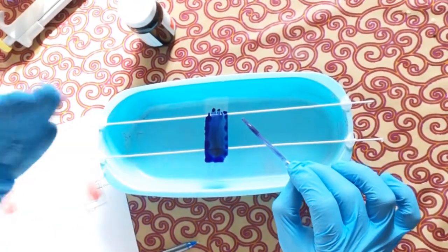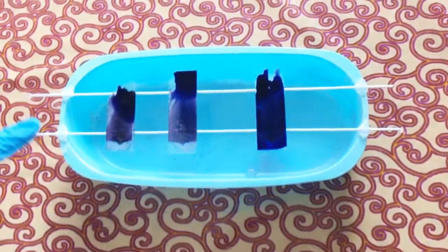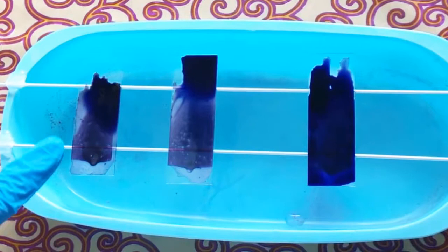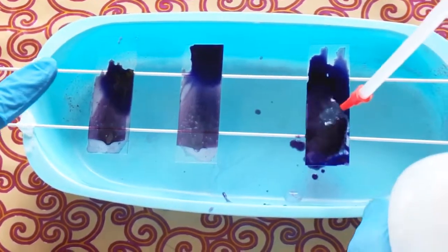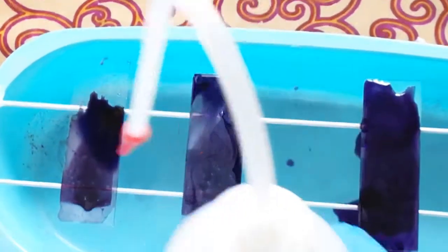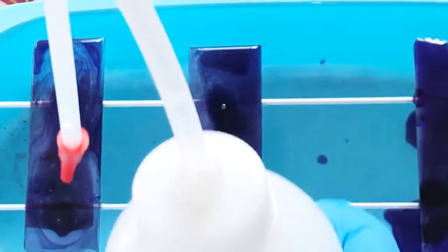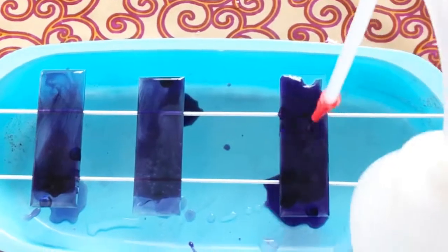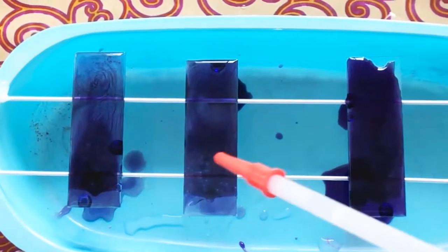After two minutes, add distilled water to the slide and leave it for five to ten minutes. Do not let the slide dry out at any point during staining. After one to two minutes of initial staining, add more distilled water to mix the stain well with the water, cover the whole slide, and keep it for the next eight to ten minutes.